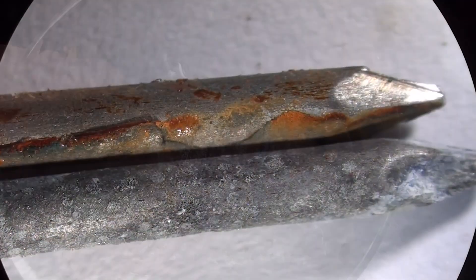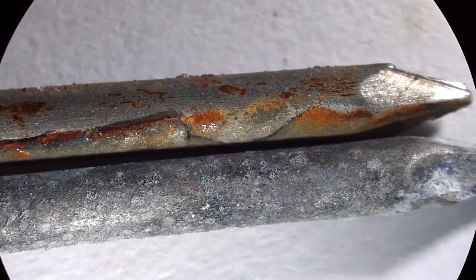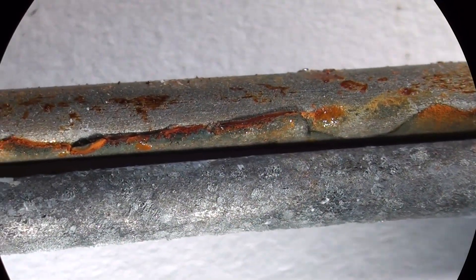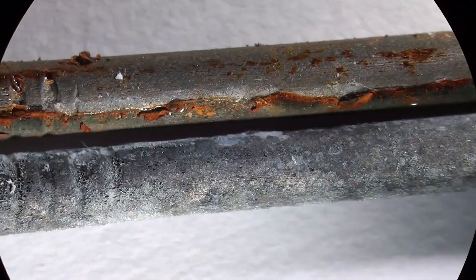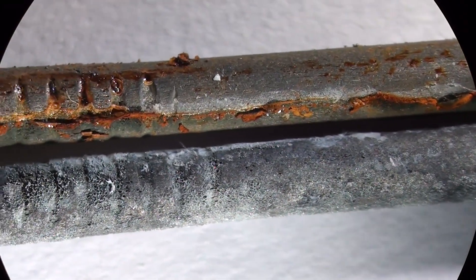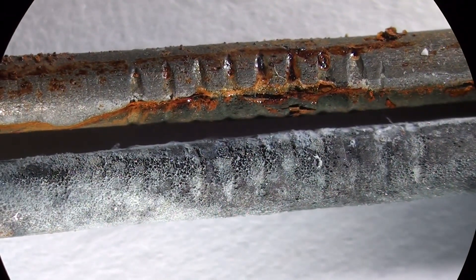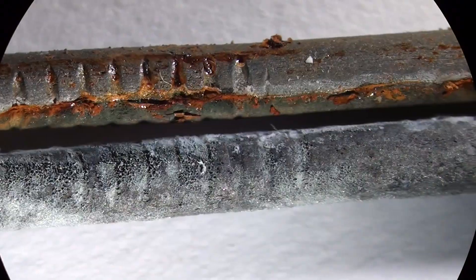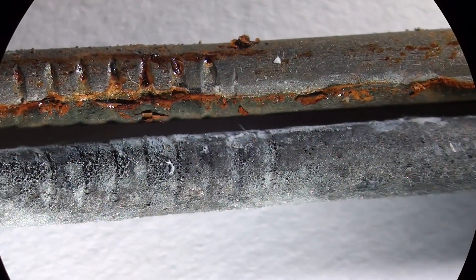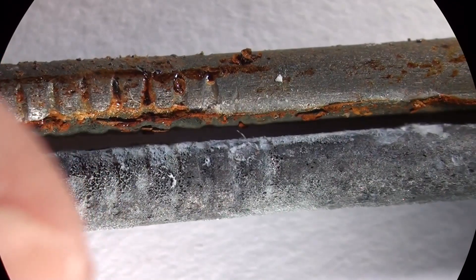Let's take a look at it under the microscope. You can clearly see the rust on the untreated nail. The galvanized nail at the bottom instead has this white powder. In truth, actually both nails are corroding, but in the galvanized nail the zinc metal corrodes first because it's more reactive, and produces this white powder of zinc hydroxide and carbonates — essentially zinc rust. That's why some old galvanized poles, sheeting, and fences have this white crust on them; it's actually zinc hydroxide and carbonate.